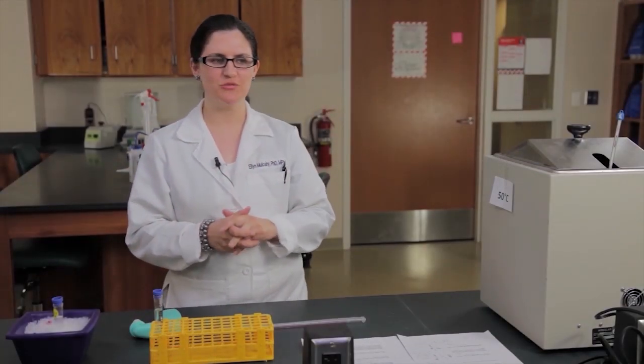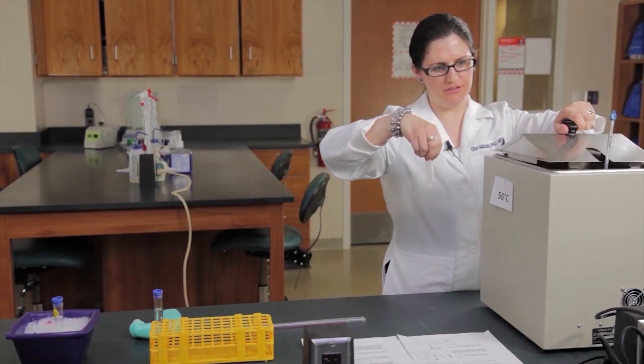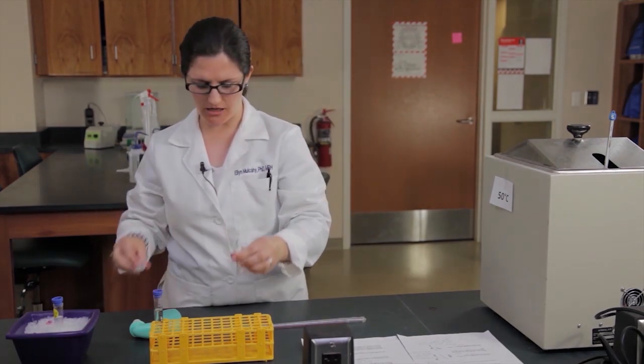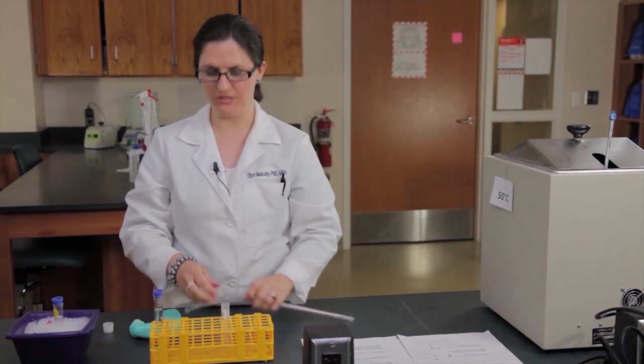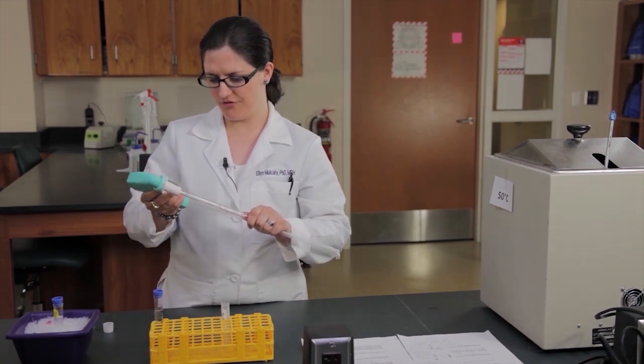So our incubation with our protease is over. So we're going to take our cell extraction out of the 50 degree water bath. And the next thing we're going to do is add cold alcohol. And the cold alcohol is going to facilitate the extraction of DNA out of the solution.